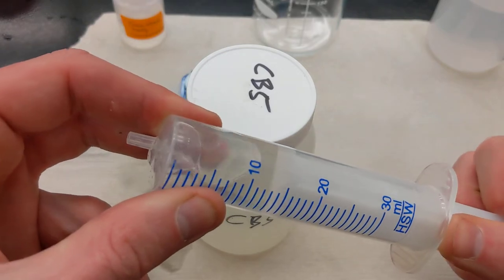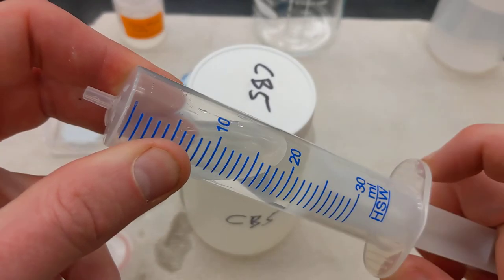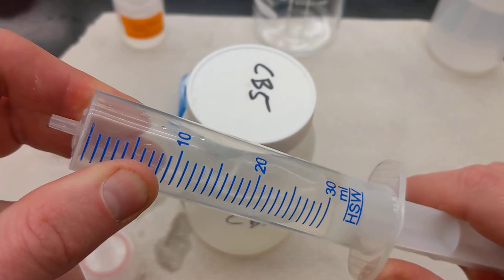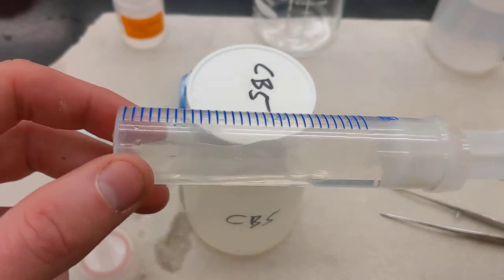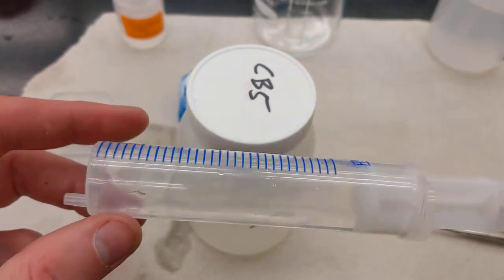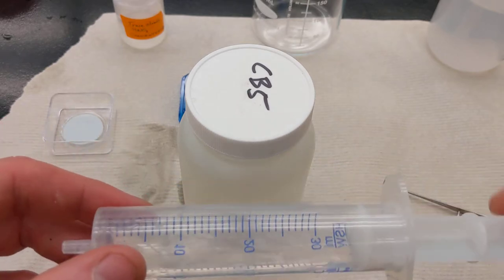Then I'm going to take the rest up to the full volume of the syringe or any volume that you would use, and I'm going to fill it with air. I'm just going to gently rotate it like this.